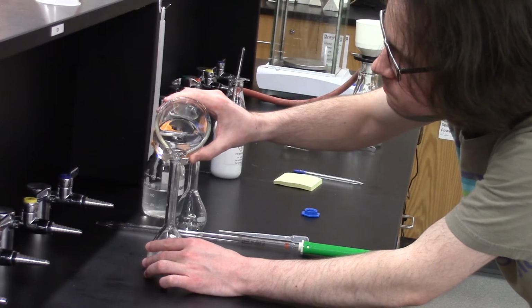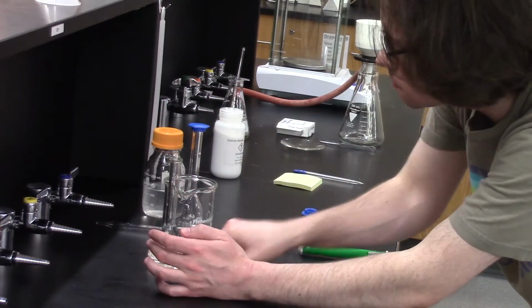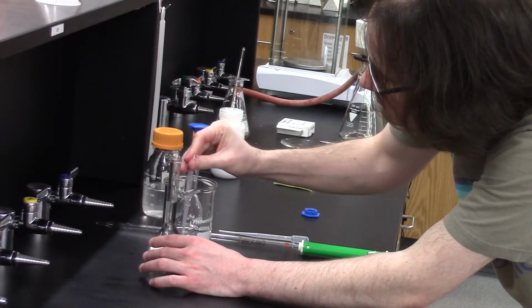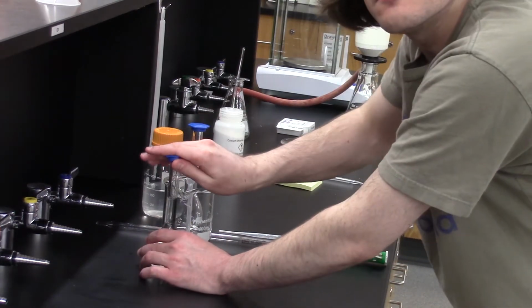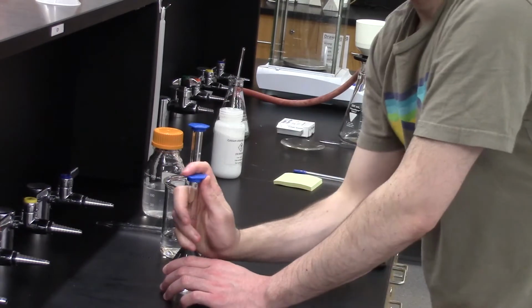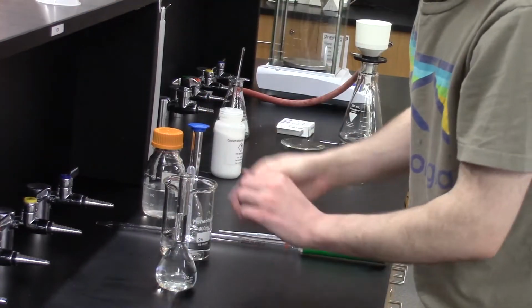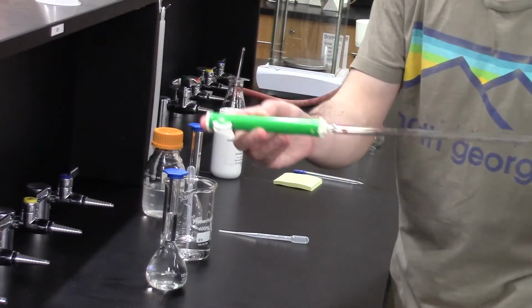Once all of the solid is dissolved, I add the rest of the water until the liquid level reaches the mark on the neck. I need to do this slowly and carefully for the last few milliliters because if you overshoot the volume marker, you have to start completely over. I cap and shake the flask to make sure everything is homogeneous. The water level fell very slightly after doing this, so I added a bit more water to bring it back to the mark, followed by mixing it again.